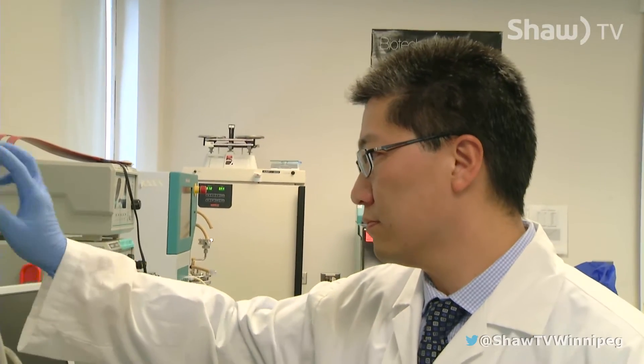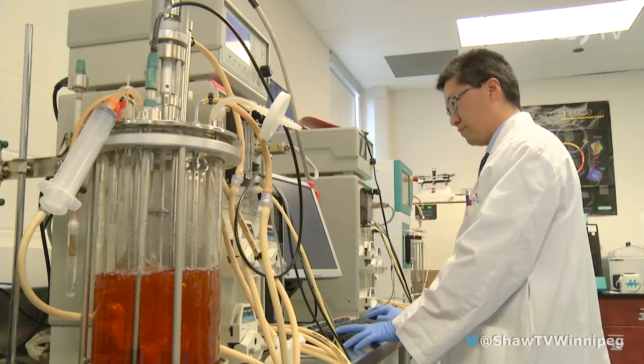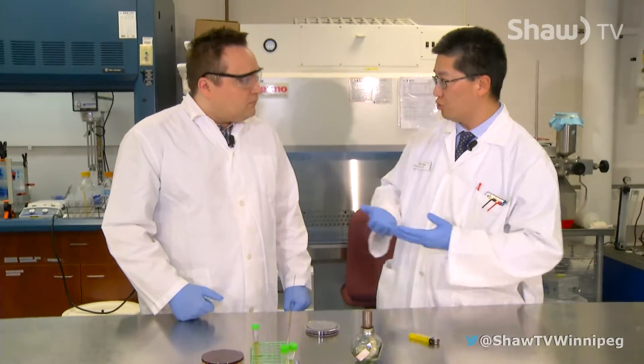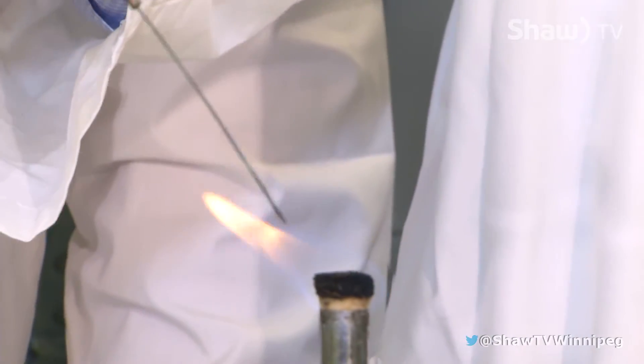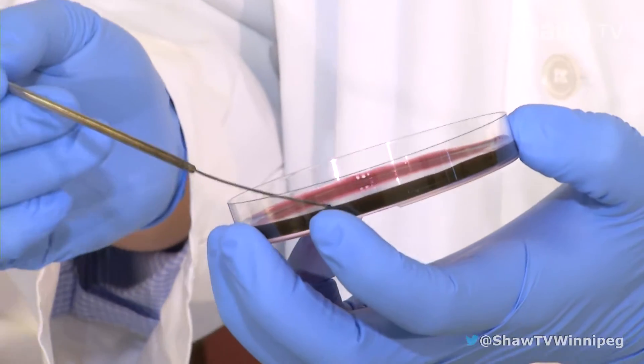This program teaches students right out of high school how to make pharmaceuticals. It started about 10 years ago with three students, and now we have upward of 20 to 25 students per year. In this lab, we deal mostly with bacteria because we are using bacteria to make a pharmaceutical.